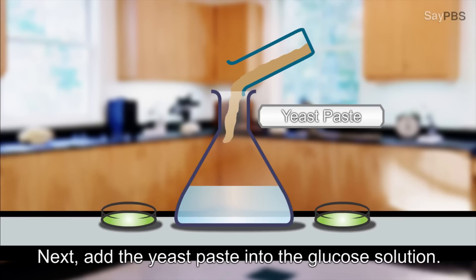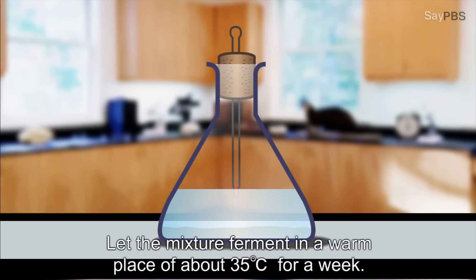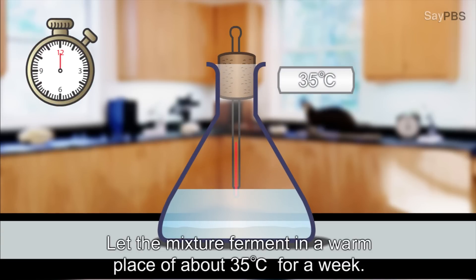Next, add the yeast paste into the glucose solution. Then, let the mixture ferment in a warm place of about 35 degrees Celsius for a week.